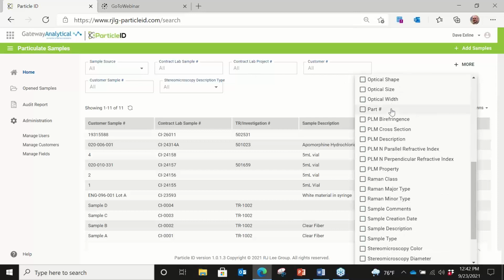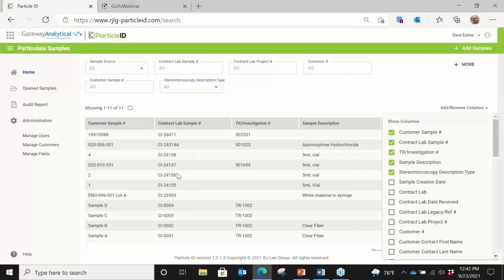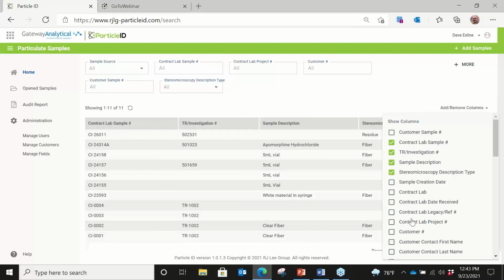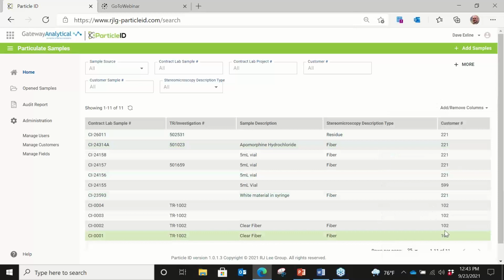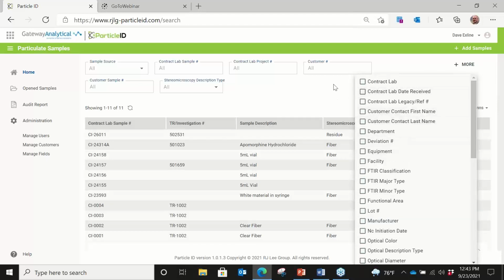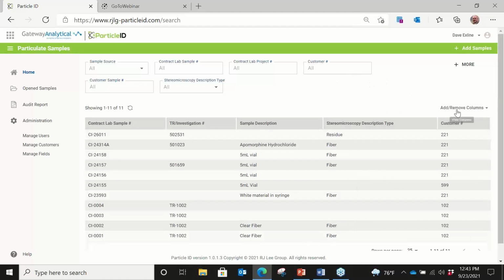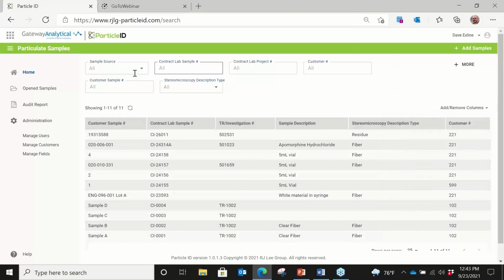It allows us to search on any parameter within the database or any type of classification, but it also allows us to look at the data in a filtered mechanism. So for example, I have it as a sample number, but I can turn that off and put something else back in if I want to. So it's a way to sort through things by any of these classifications, whether it be the analytical data or the sample data, or anything for that matter. So that's the ability to go through and sort. We have the ability to look at audit reports. We have the ability to manage our users and the fields that we do.